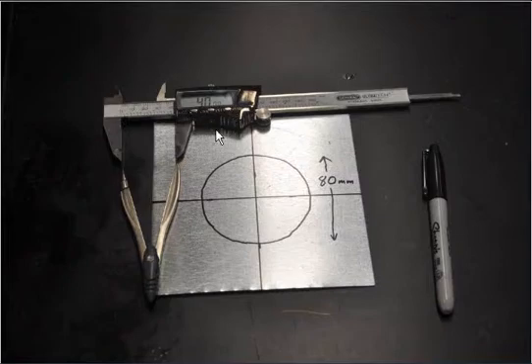To do this, I used calipers to measure out 40 millimeters and then set a, what is this thing called? I've forgotten. The thing you use to draw circles, which is what that is, and set it to a width of 40 millimeters, put it in the center and draw my circle. Then I just highlighted the circle in black so that you can see it on the image, which made it not nearly as good of a circle as it was when I originally drew it. And then the diameter is marked as well for you to see.